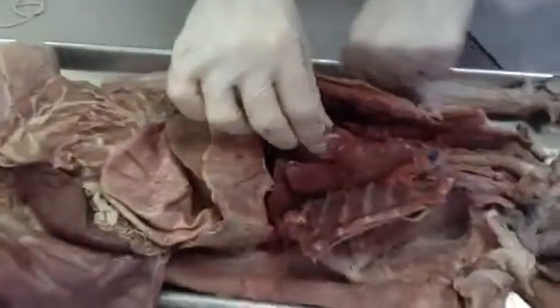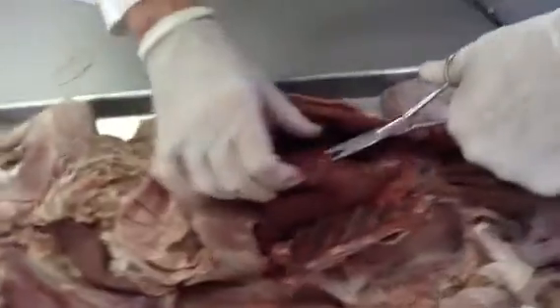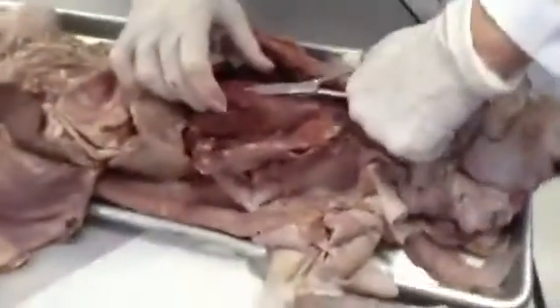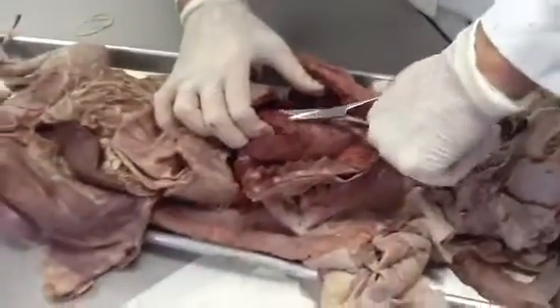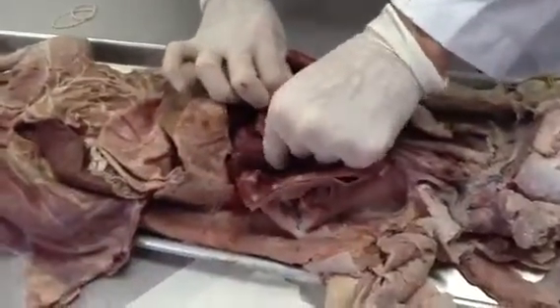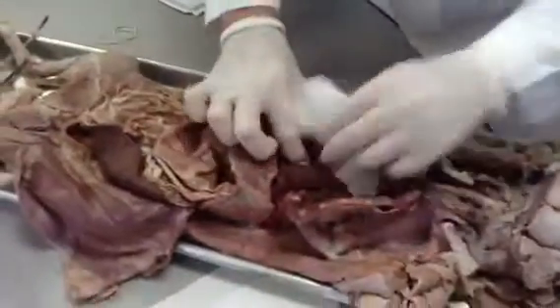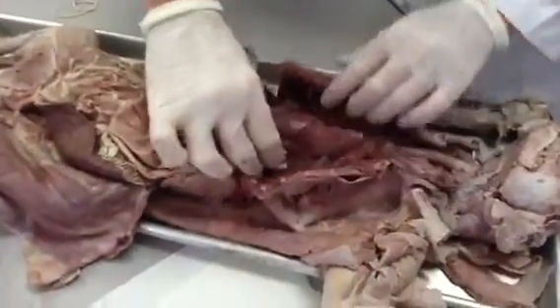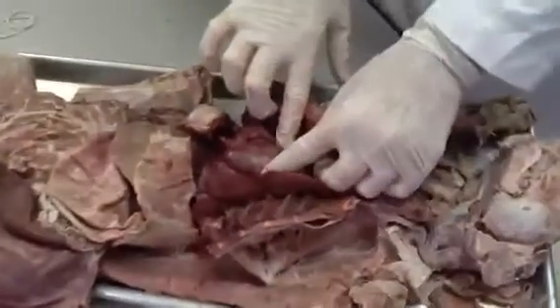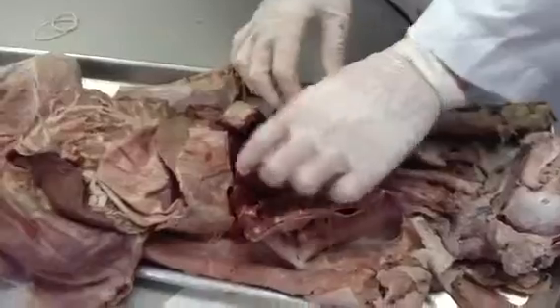Medial to the lungs is the heart. Covering the heart is the pericardium, which is the serous tissue that secretes serous fluid, which decreases friction between the heart and the lung. When you remove that, there is a little bit of fluid there, the serous fluid. You can see the heart medial between the two lungs. It has two auricles on top, which deep inside are going to be your atria, and your two ventricles.